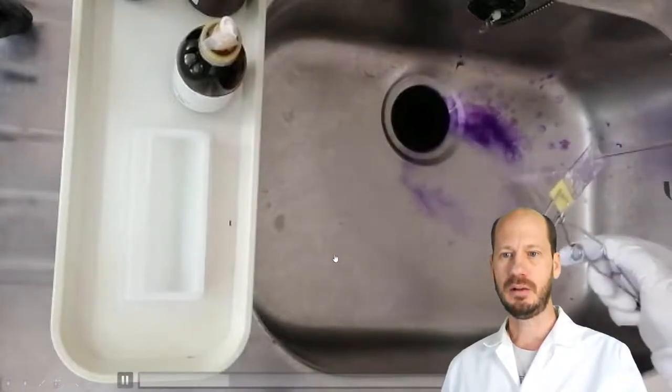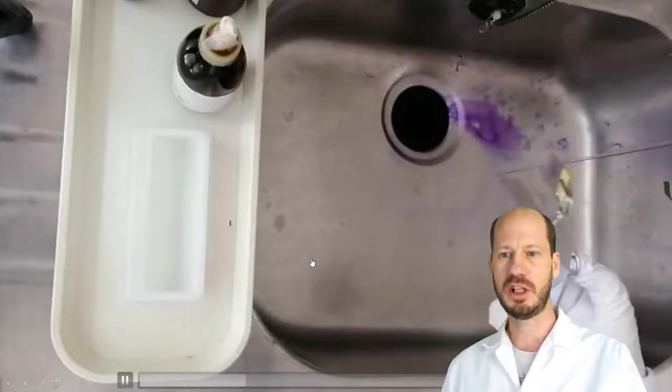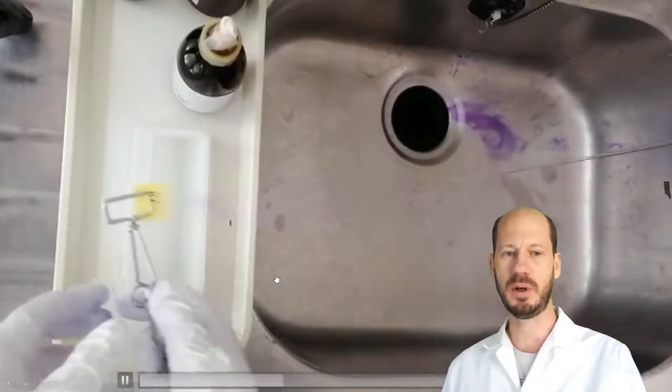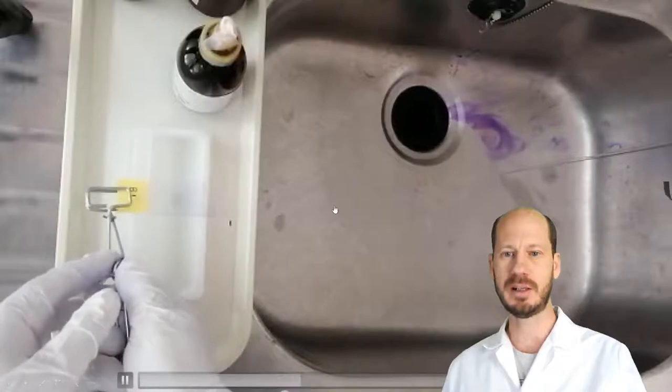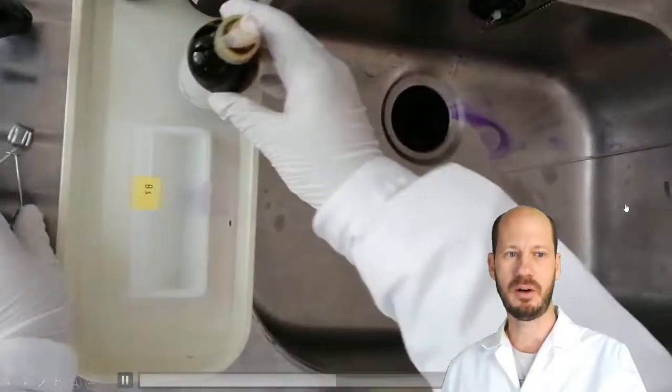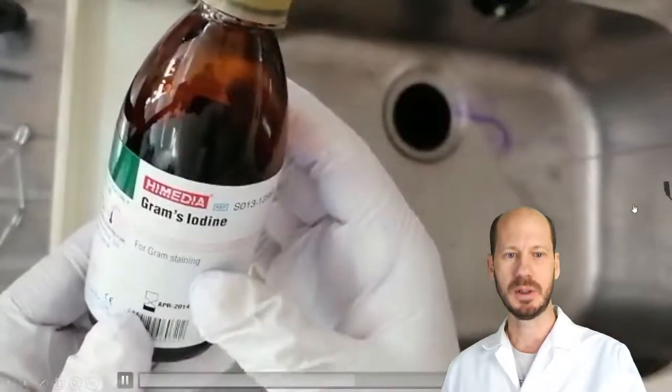This is done not very carefully now in this demonstration, but you can do this very delicate if you don't have a lot of cells. In this situation, because we used a huge amount of cells, it doesn't matter too much if we use a lot of water in this washing process.